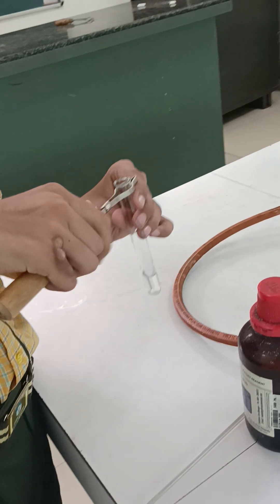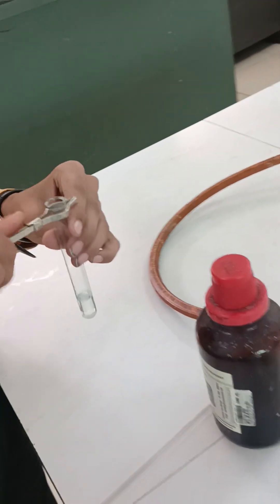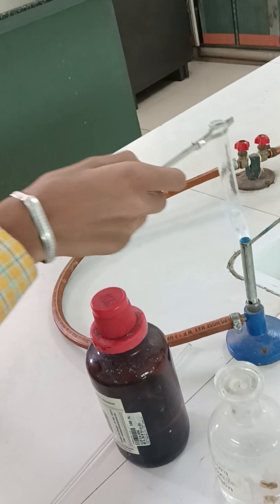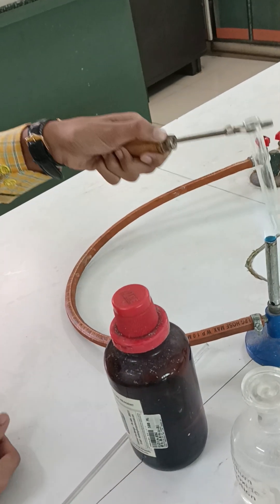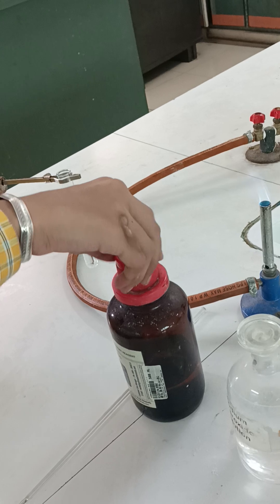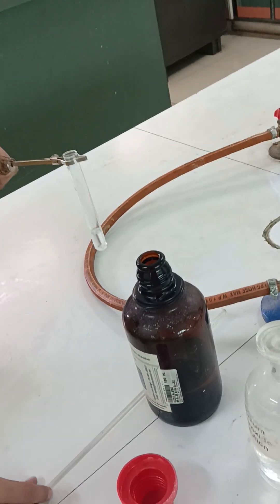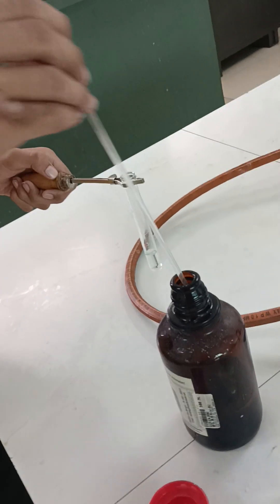We have to observe whether any gas is released. Right now there is no observation, so we have to heat it. The presence of ammonia can be detected by dipping a glass rod in concentrated HCl and bringing it near the mouth of the test tube.